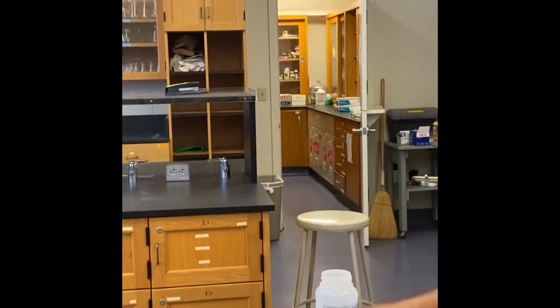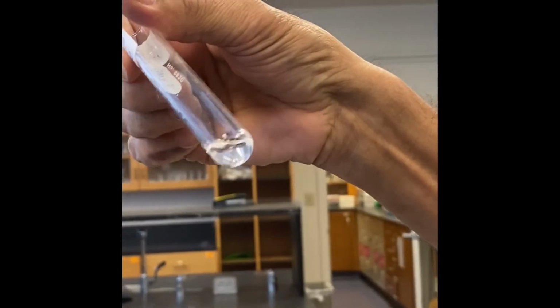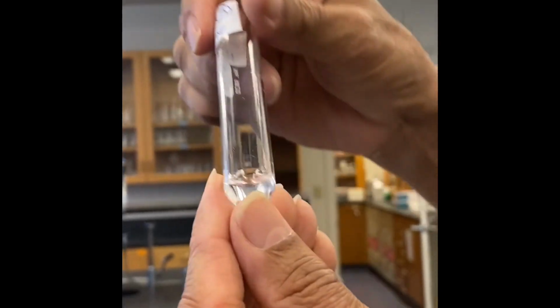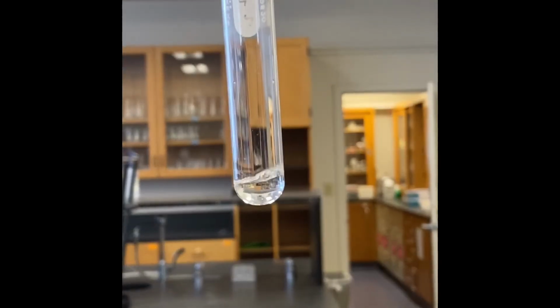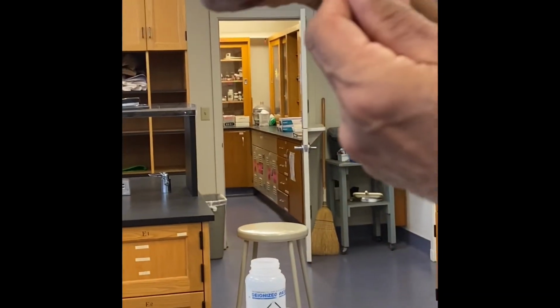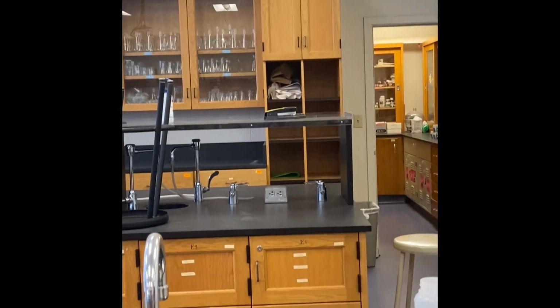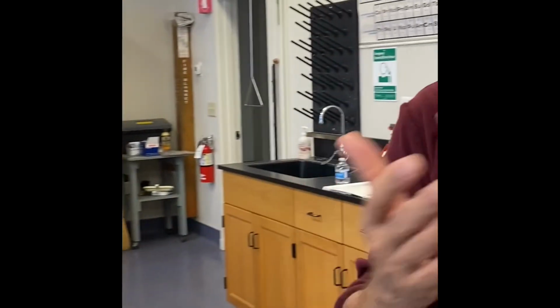So we say it partially dissolves. Let us see hexane. Well, there is one crystal left, but you can say it dissolves. So in hexane, biphenyl dissolves, whereas in methanol it partially dissolves. In water it does not dissolve. So we prove the point about non-polar and polar solvents, and this is the reference.